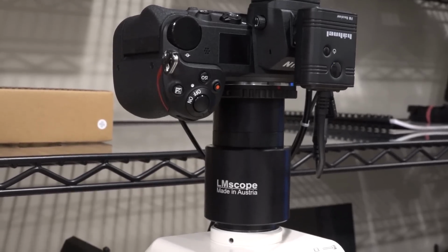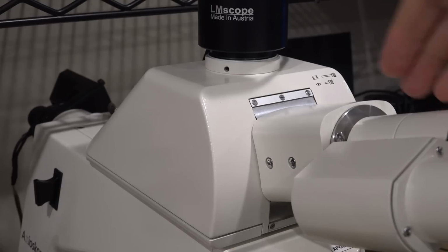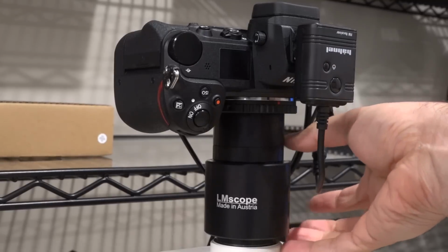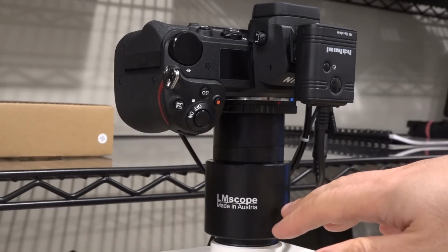Now, the photo tube that I'm using with this particular microscope is one of those ones that either puts the light into your eyes or puts it into the camera. There's some advantages to that because it's not splitting the light into two, so it preserves all the photons essentially into one or the other, but you can't look at them at the same time, which is not a problem in my setup. I tried many different interfaces here, and all of them either gave me some bad coverage of the sensor, or they had some softness to the images that were captured. It really wasn't working. And finally, I said, I'm just going to go with a good, expensive solution.